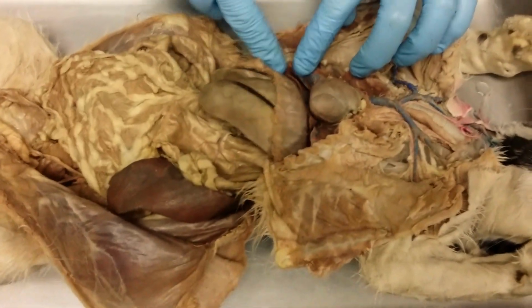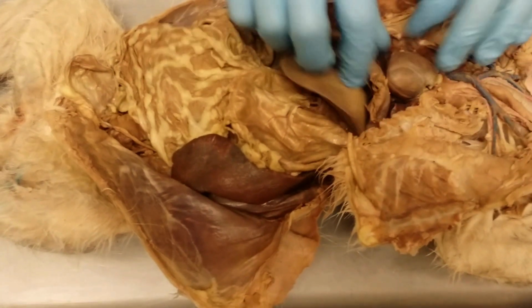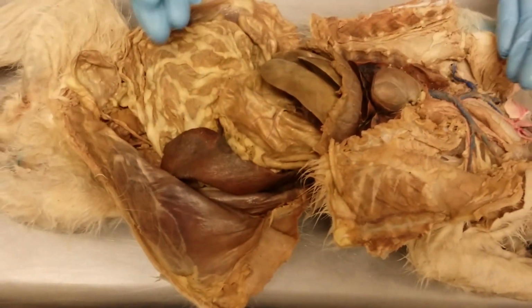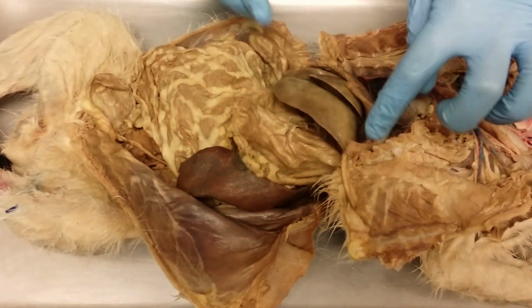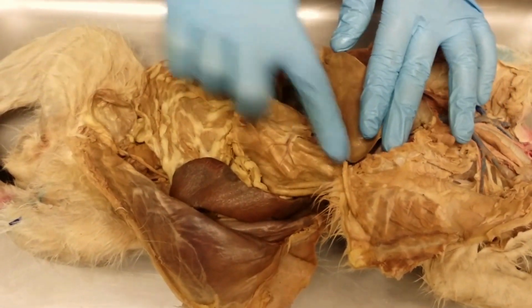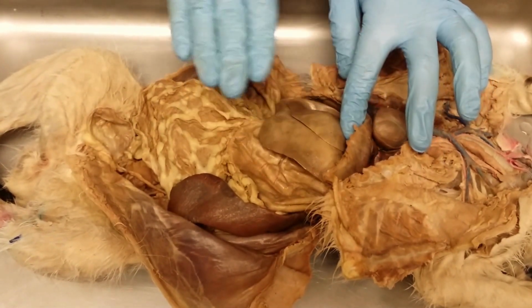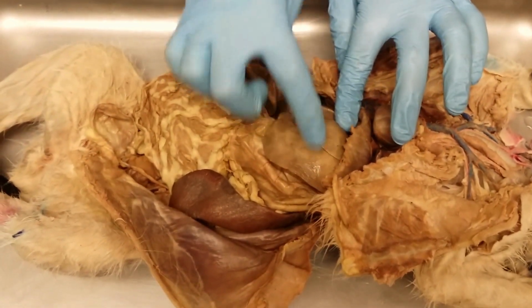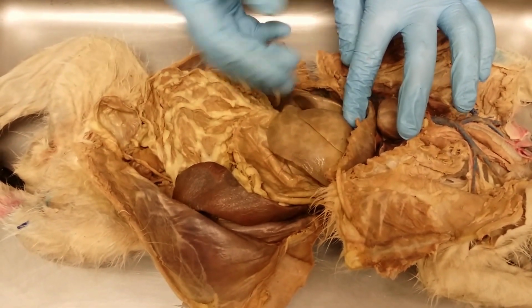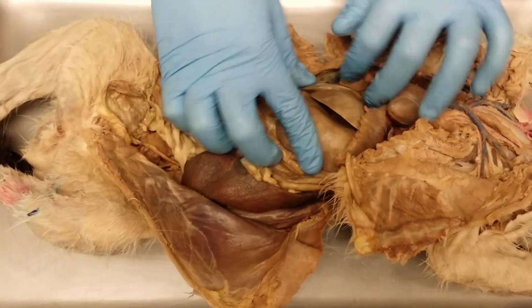It will enter through the diaphragm and then into the stomach, okay? So here's the diaphragm, which separates the thoracic cavity from the abdominal pelvic cavity. Pull this liver away, here's the stomach. This sac-like organ, kind of C-shaped, this is the stomach. Lying on the anterior side of the stomach, this is the liver, multiple lobes, huge organ, tucked right up underneath the diaphragm. This is the liver.